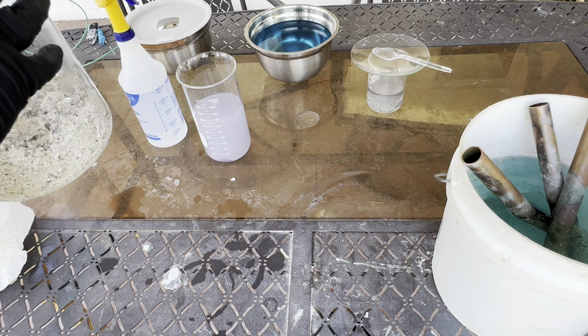That silver you saw me pouring — I'm using this 400 milliliter beaker. We've got that German glass boiling away with the silver in there. I added 25 milliliters of nitric acid to dissolve what I estimated to be about 40 grams of silver — could be more, could be less. That is to form more silver nitrate, which I will add to the silver cell throughout this week.